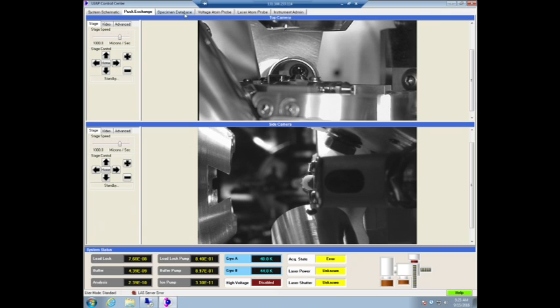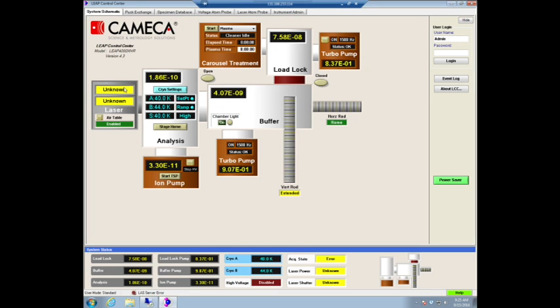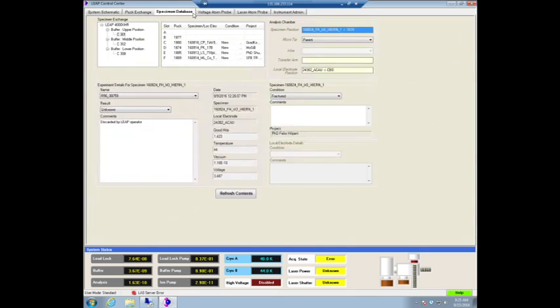Okay, so now we're in. And what you can see now is we might just integrate to fix whatever laser communication error we have. We just need to, okay.